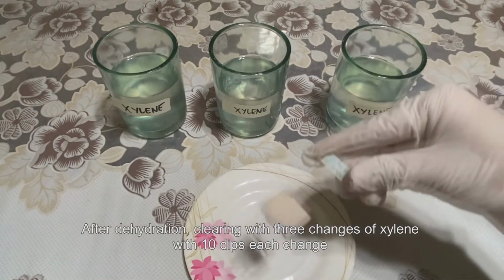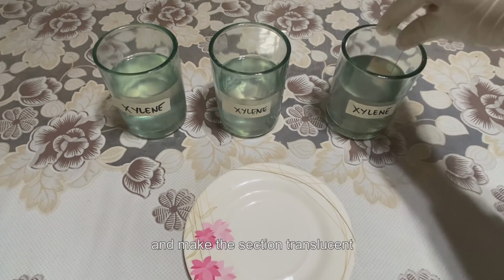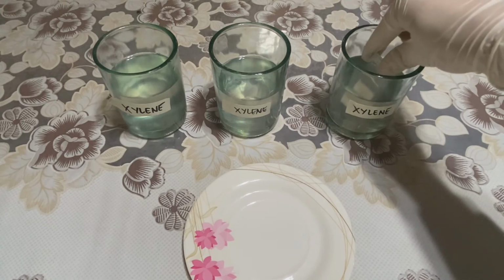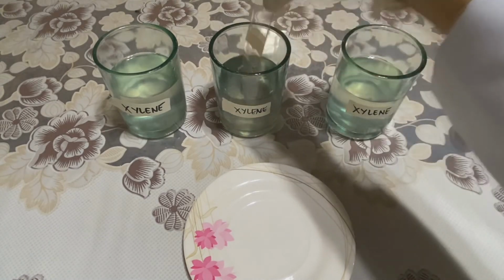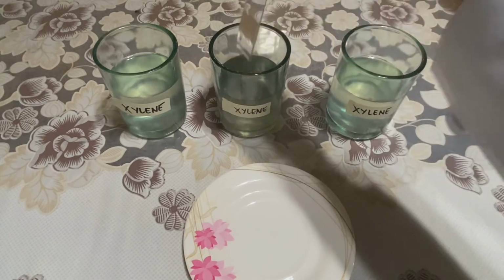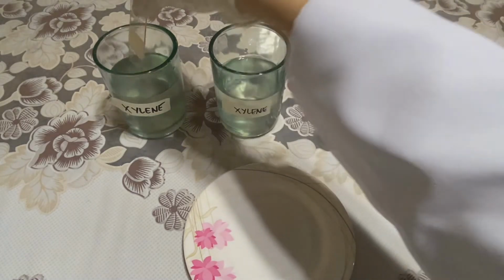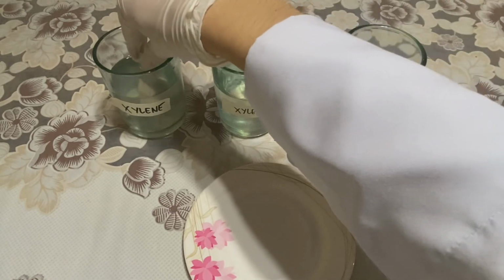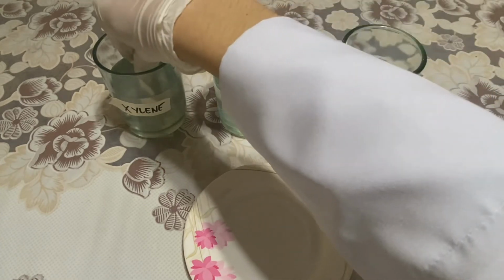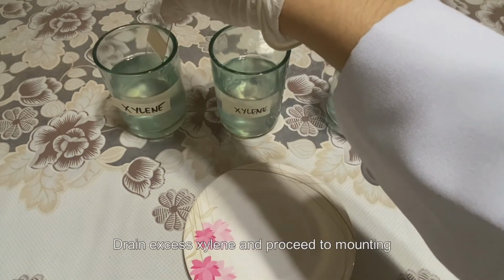After dehydration, clearing with 3 changes of xylene with 10 dips each change should be done to replace alcohol and make the section translucent. Drain excess xylene and proceed to mounting.